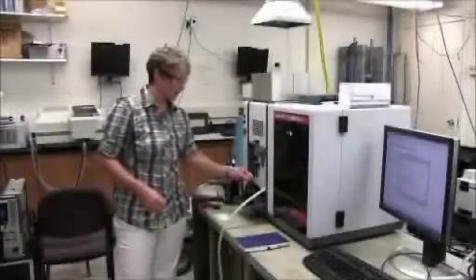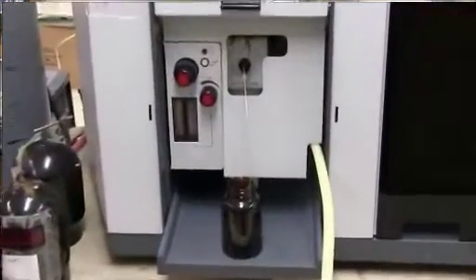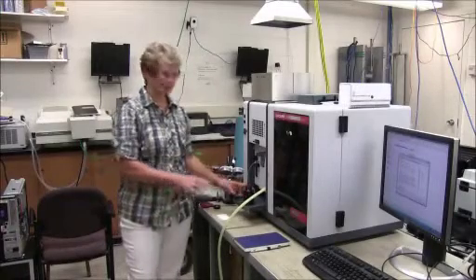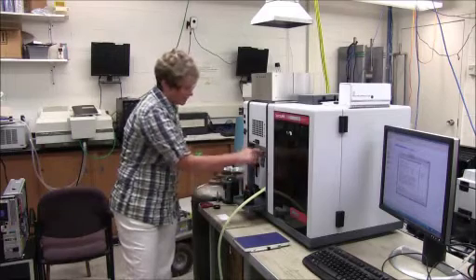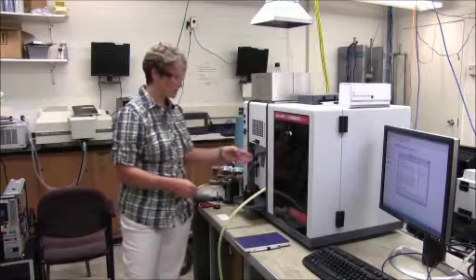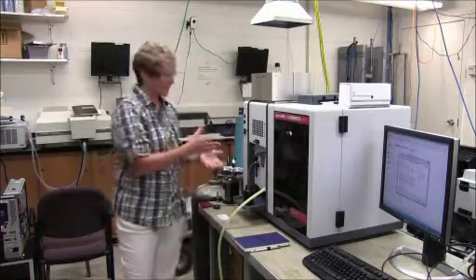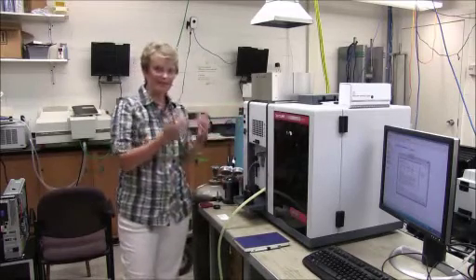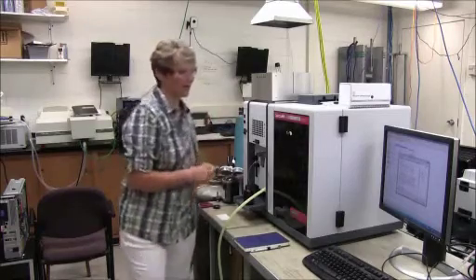Then this is the capillary tube, which brings your sample up and into the burner. So all samples are in an aqueous solution, and the nebulizer is this area in here. What it does is, the capillary draws the fluid up, the nebulizer puts it into the gaseous form, and it's the atoms that are actually going into that burner and being excited, and it's the absorption of those that is detected by your detector.